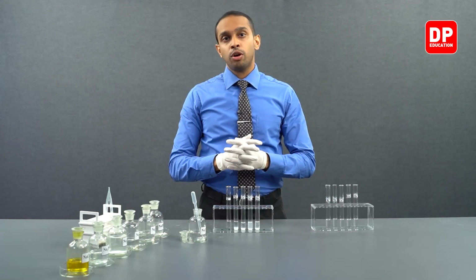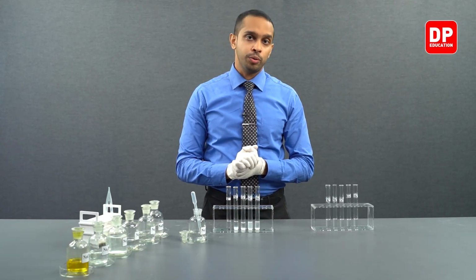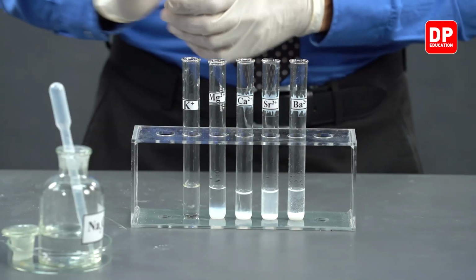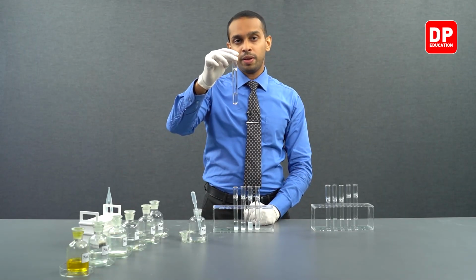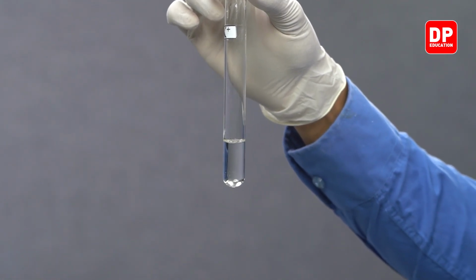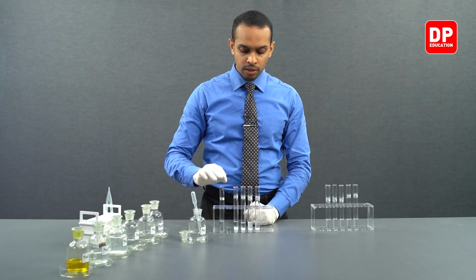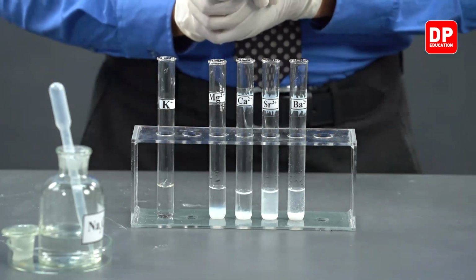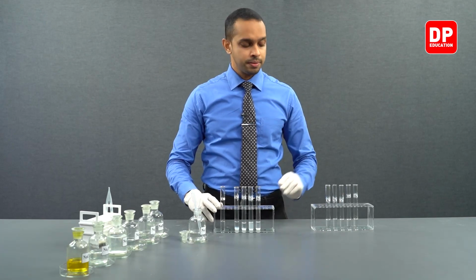Solubility of the carbonates of group 2 compounds will decrease as you go down the group. So, as you can see, except for the group 1 element that we have here, the potassium 1 plus ion solution, when reacted with carbonates, we did not see the formation of a precipitate. But except for that, all the group 2 carbonates produced precipitates. Let's move on to bicarbonate ions.